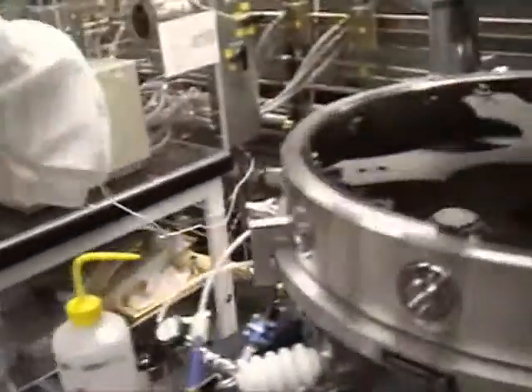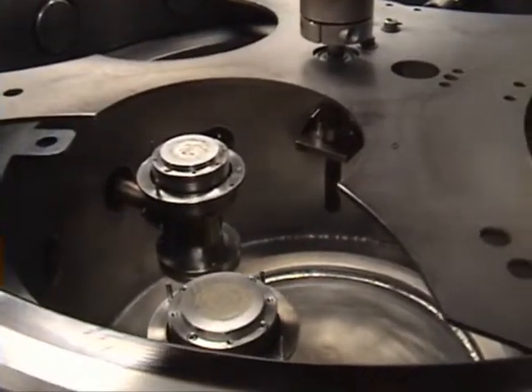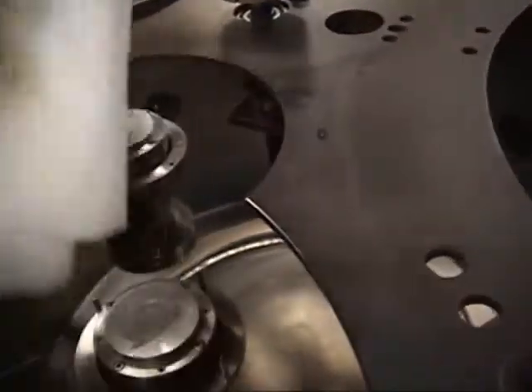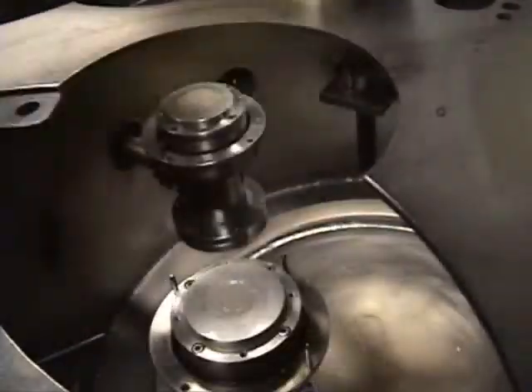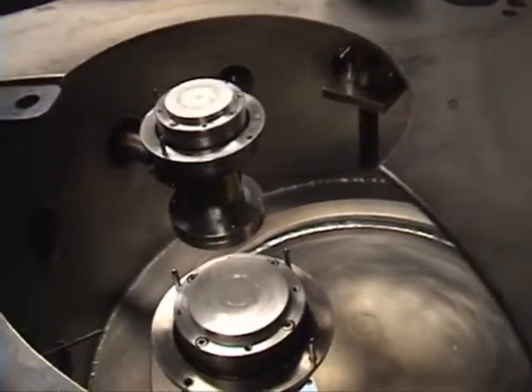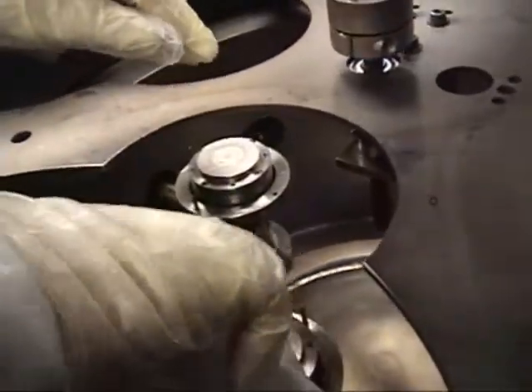Remember, you have to clean your magnetic table — we have silver paste. IPA on your wipe, going to clean up the table. One more time, make sure I have everything off my magnetic table — that would cause a problem for the next user.